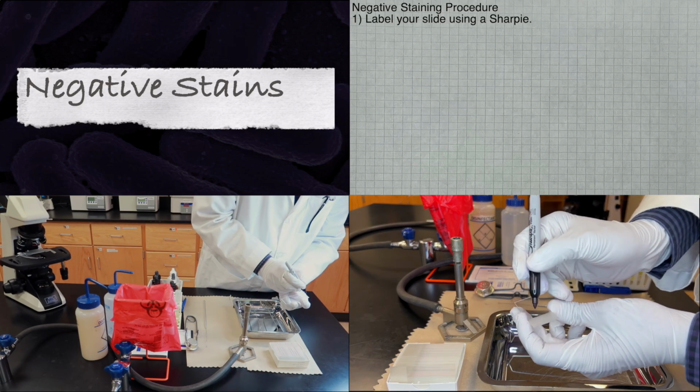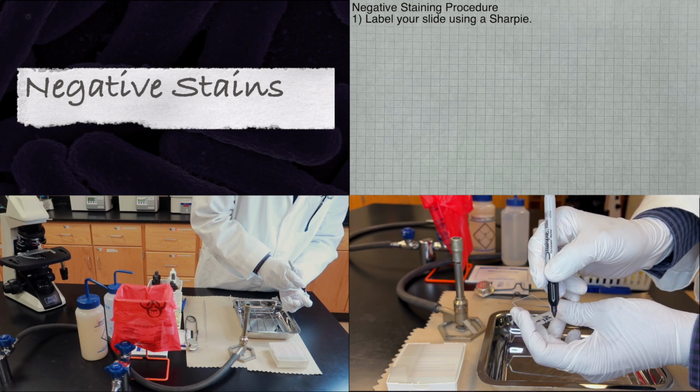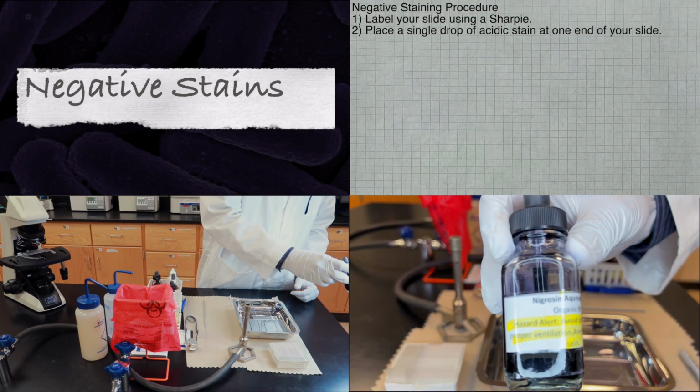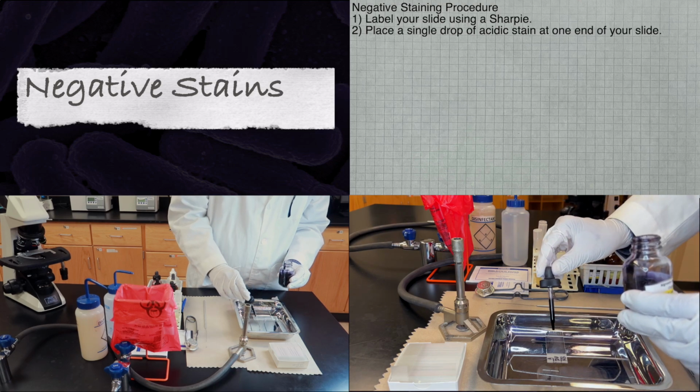In order to begin the negative staining procedure, first label your slide using a Sharpie. Next, please place a single drop of acidic stain at one end of your slide.